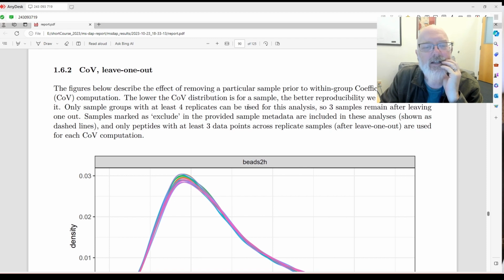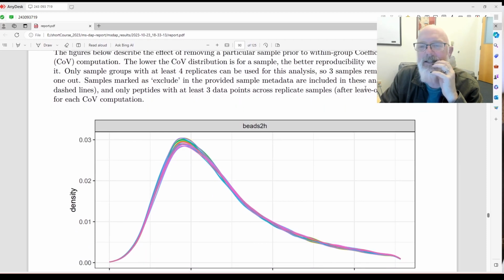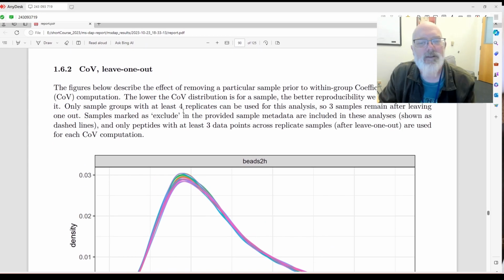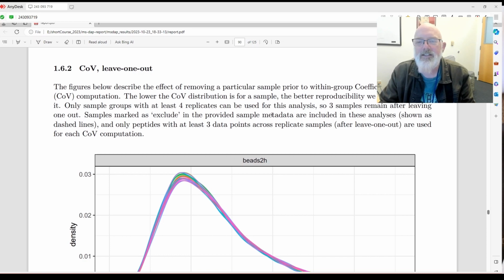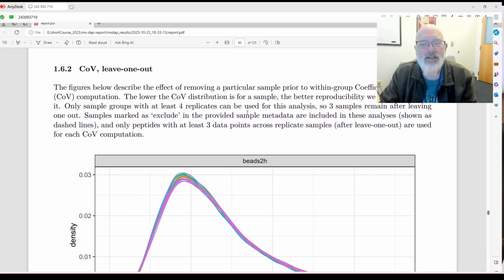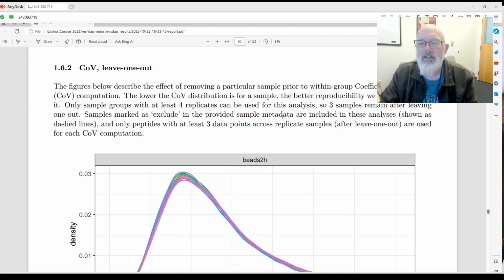Okay, this figure describes the effect of removing a particular sample prior to within group coefficient of variation. The lower the COV distribution is for the sample, the better reproducibility we can get by excluding it. Only sample groups with at least 4 replicates can be used for analysis, so 3 remain after leaving one out. Samples marked with exclude in the provided sample metadata are included in the analysis, marked only as dashed lines.